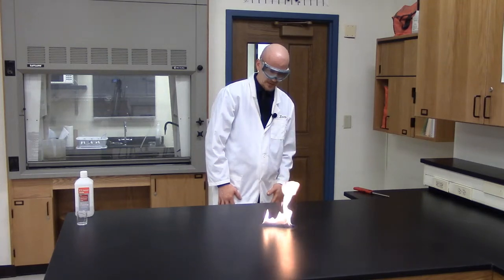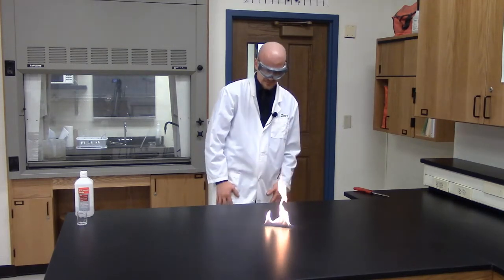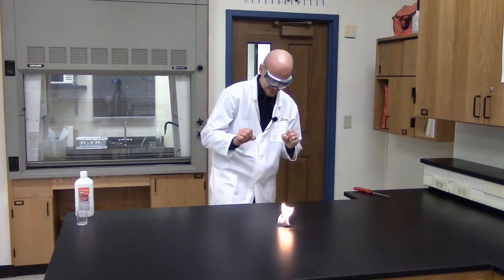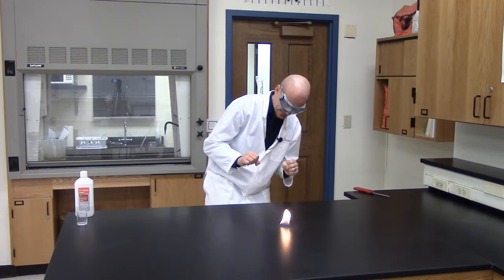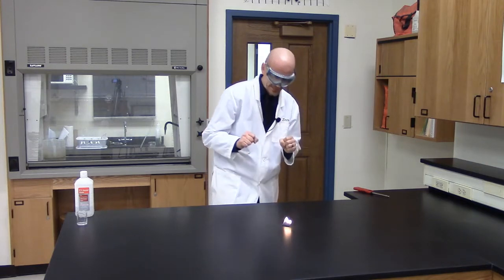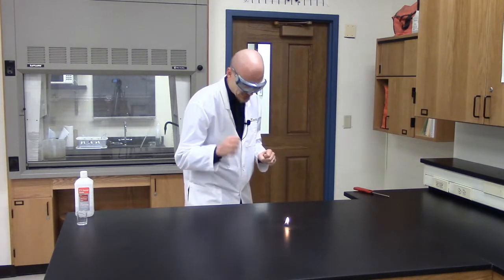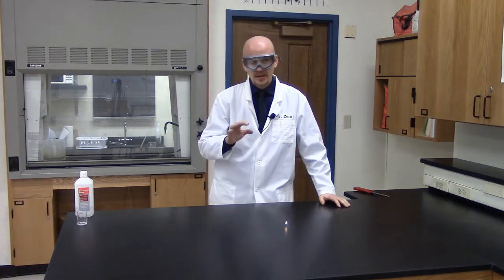And it's just about done and almost. Still hanging on and just about done. So I can still breathe.